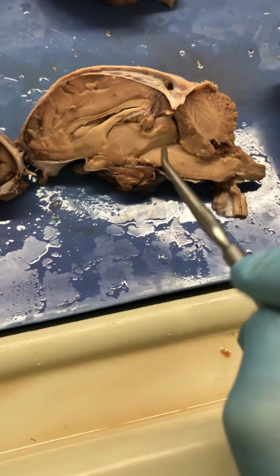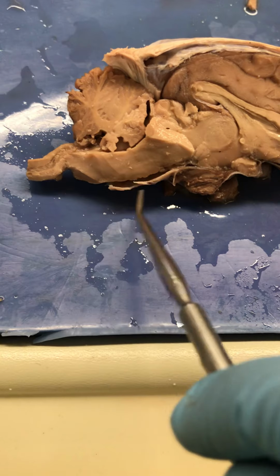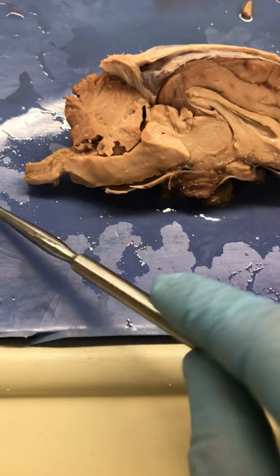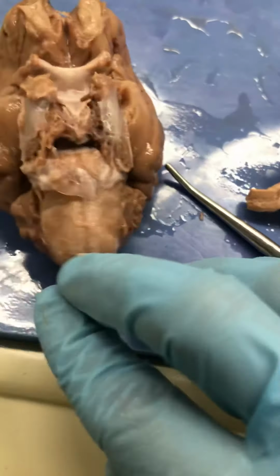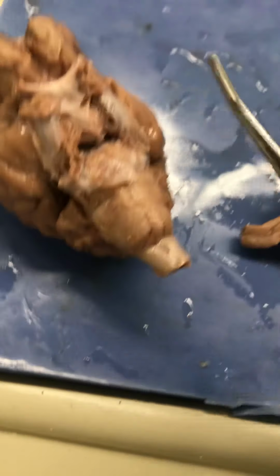That's why it's part of the brainstem. And this is it here as well. So it's in between the pons and the spinal cord. Oh man, you can see the central canal real well there. And then if we look at our brain here, this is that medulla oblongata. It's real fat. This is a big area. Big nerves come through here.